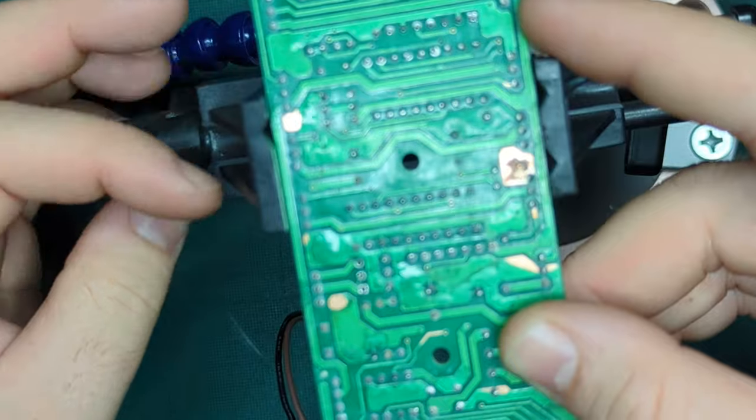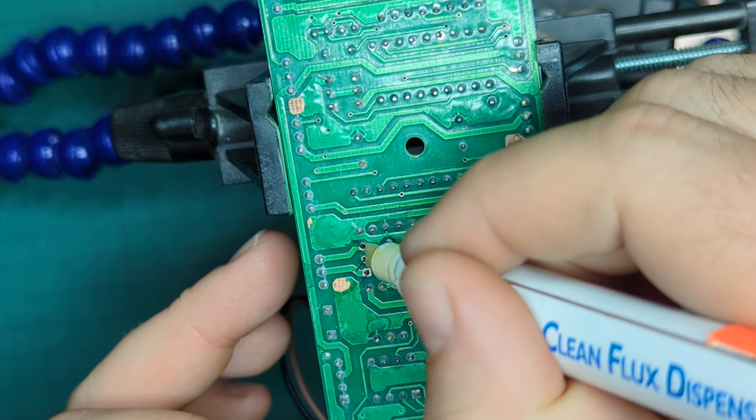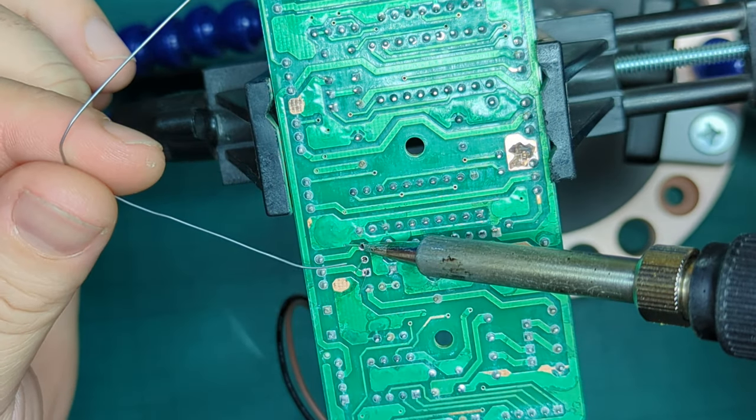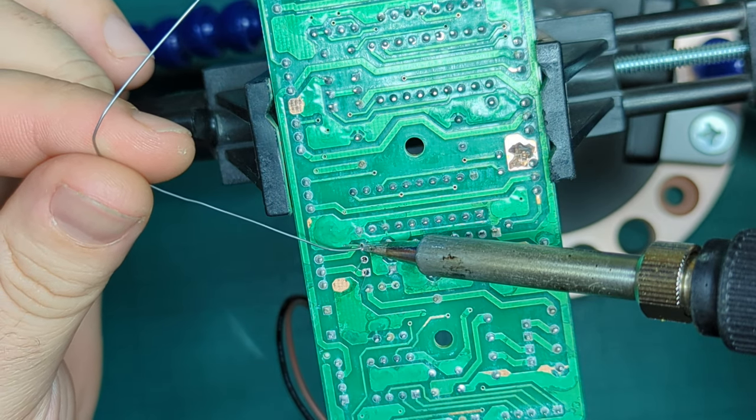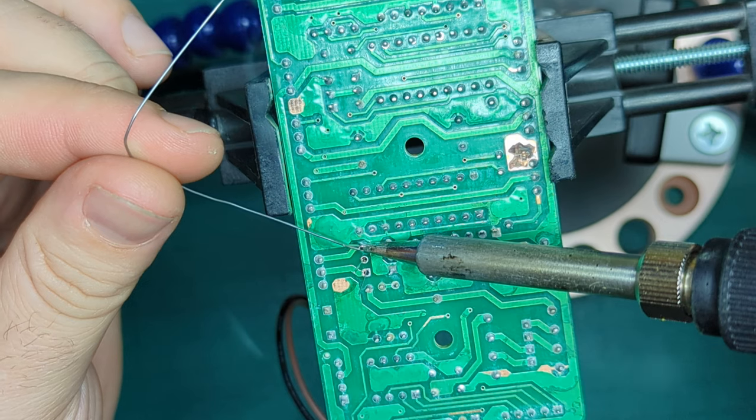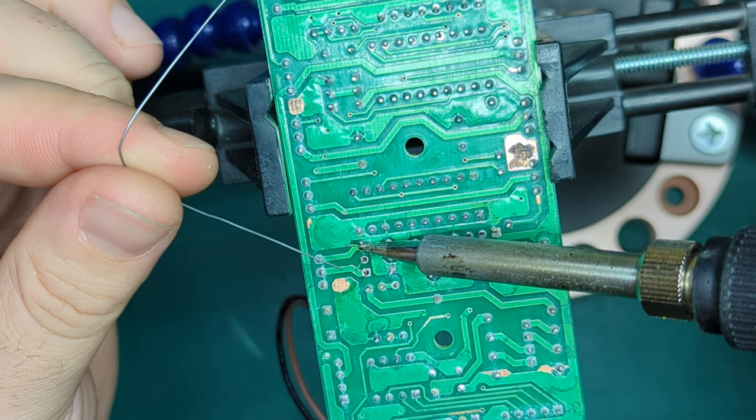You can see that some of the PCB green bit has kind of broken off in the cleaning process, but I'll get onto that later. First, I just need to make sure there's a good electrical connection here, so some flux and then soldering until the solder comes all the way up the legs of that transistor.